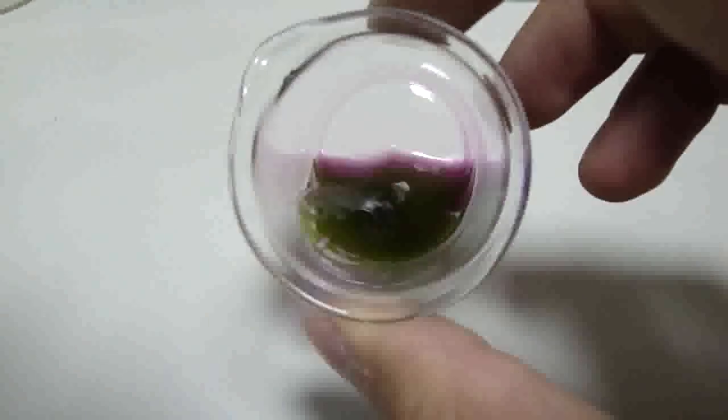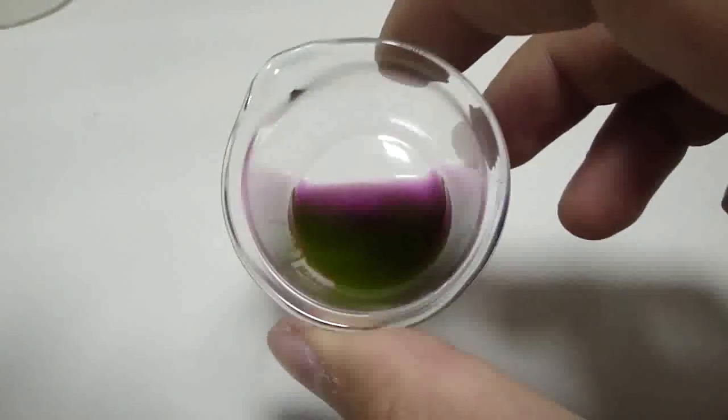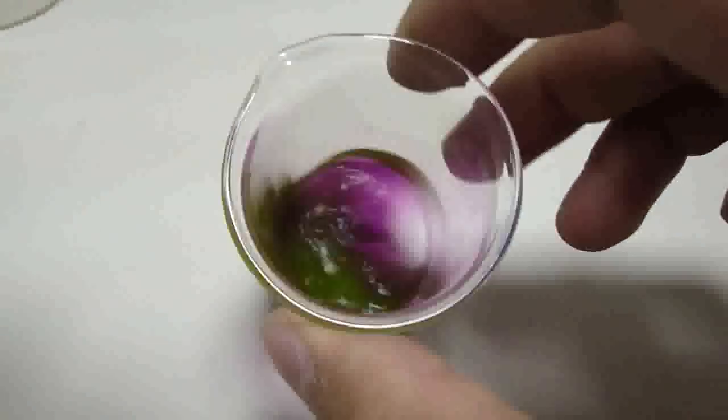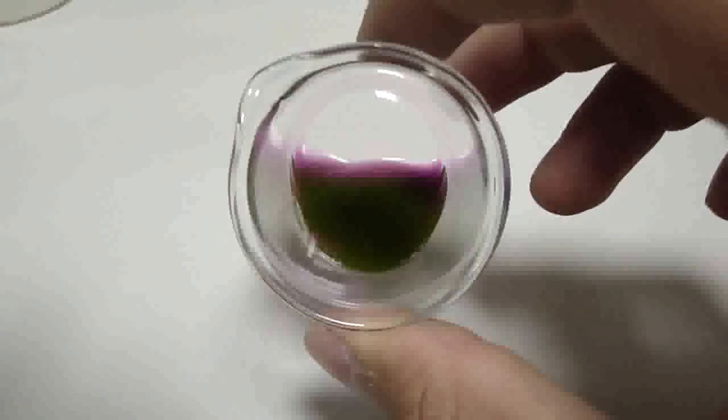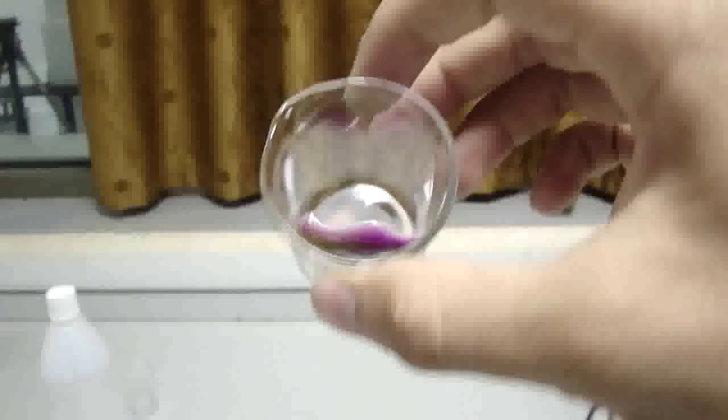There is something special in light chemistry here. I hope that someone helped me in discovering what we call this phenomenon. The green color comes from nothing.